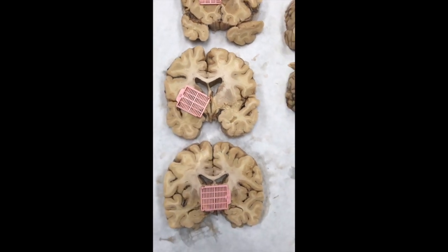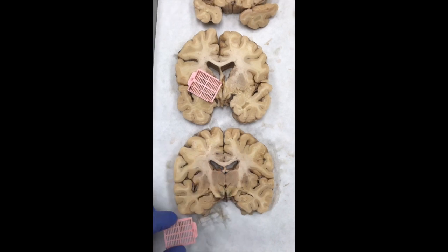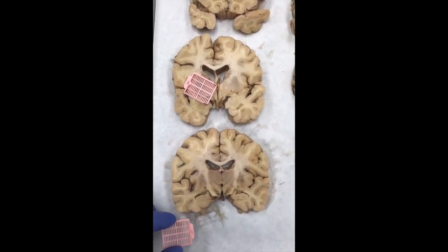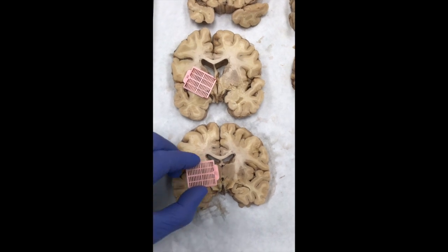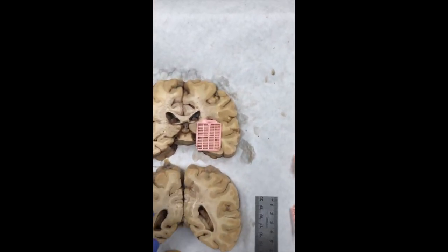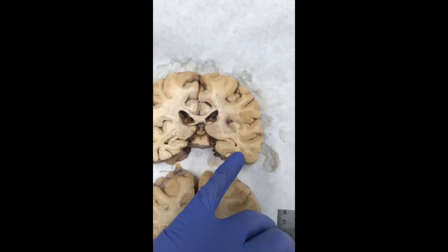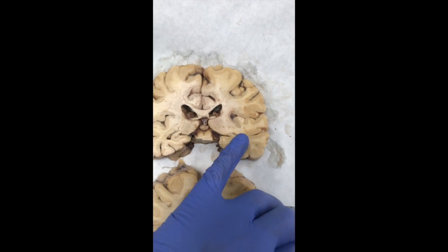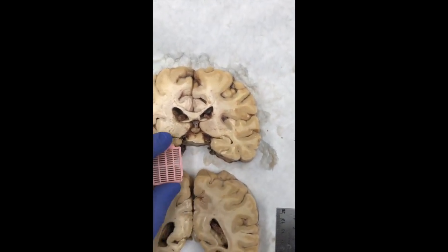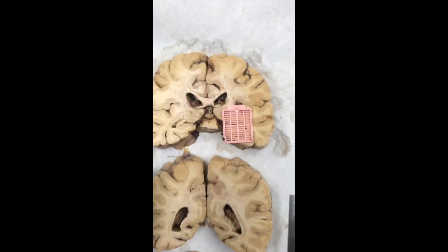section. Then in section D, we will take a midline section, including the thalamus, some of the third ventricular structures, perhaps even the red nucleus at the base there. Then section E will come from the hippocampus, and it will include lateral structures of both ventricle, white matter, and choroid plexus. And what's not visible will also be included in the section is the tail of the caudate.